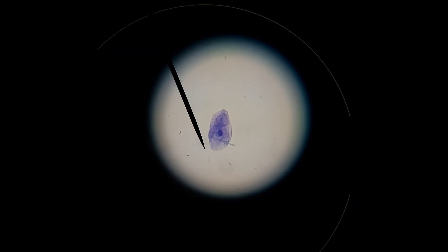And there I have my cell with the nucleus. I will now use the needle that's on the eyepiece to demonstrate to you where the nucleus is located just at the tip of that needle there. And there we go. An animal cell nicely found with the nucleus clearly stained with methylene blue.